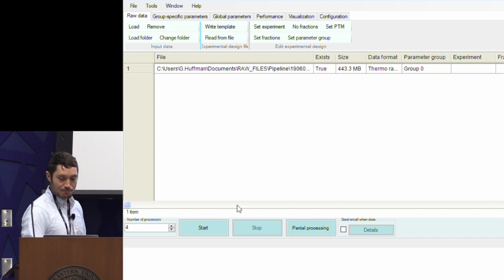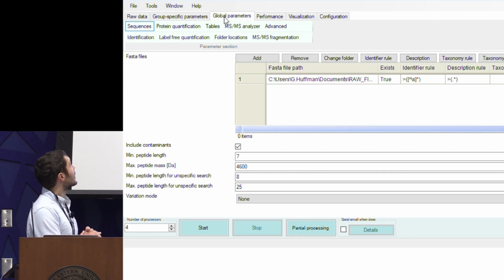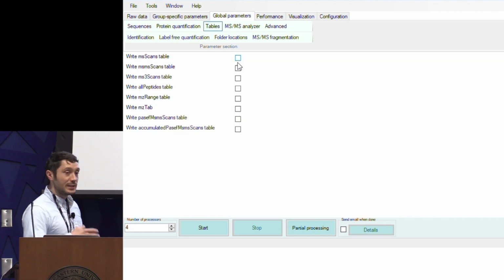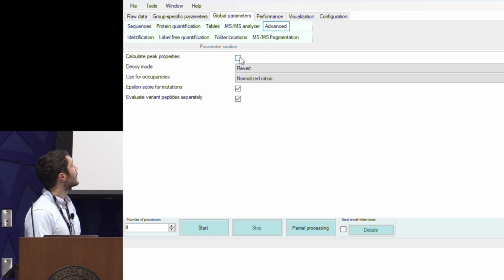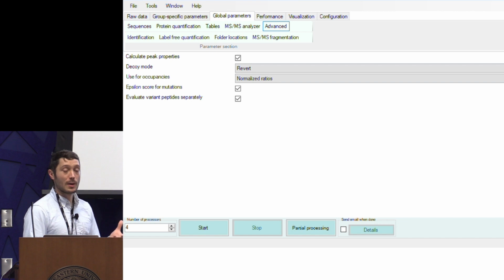Now, in order to use DoMS to its full capability, you'll need to enable a couple of options within MaxQuant. So within the Global Parameters tab and the Tables subtab, you'll need to enable the output of a couple of different data files, which are MS scans, MS/MS scans, and all peptides. And you also need the Calculate Peak Properties option, which gives you some additional information about where you're sampling your precursor species. And we'll look at that a little bit later.